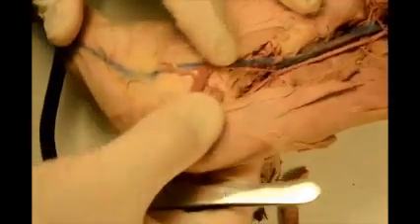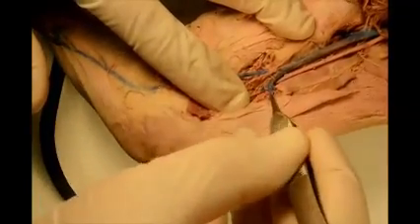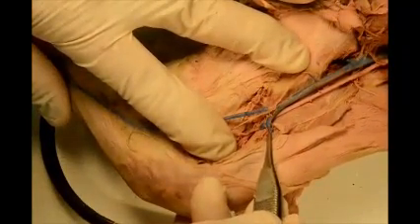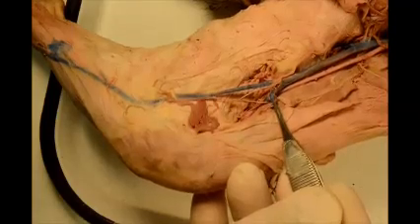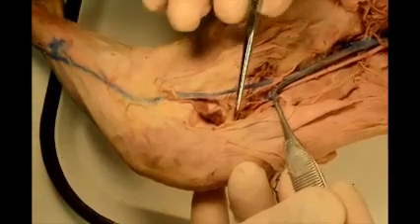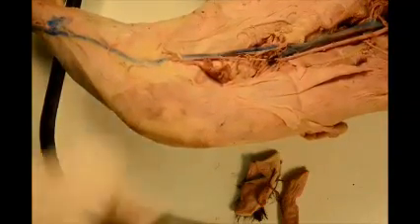The veins are named similar to the arteries. On this cat, the superior articular vein was broken — there's only a little piece of it left, which is what I have here in the forceps. But right inferior to it, you can see the popliteal, which goes behind the knee. So superior articular, popliteal, and saphenous. And that should be the end of the veins.